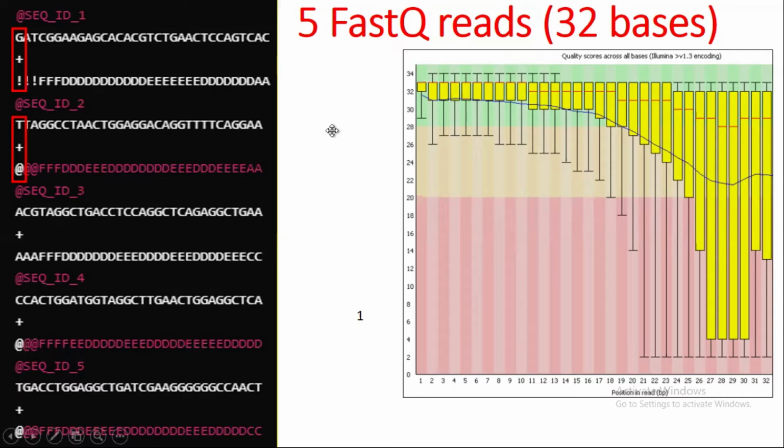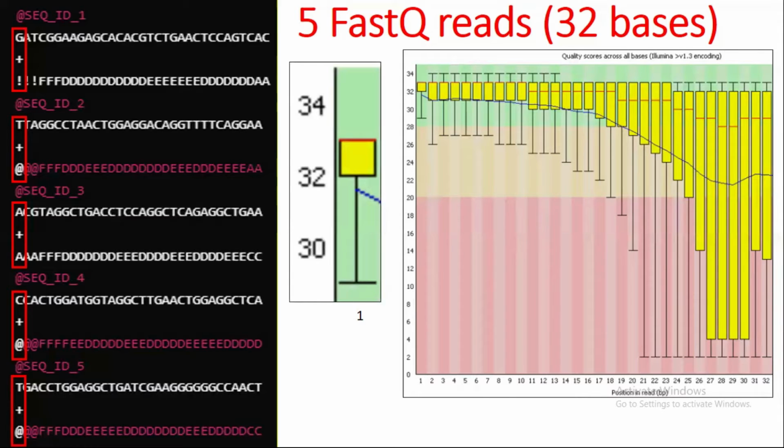These are my first base pairs, and I want to check their quality. It will be shown as a box plot, and this is the box plot for the first base pair. Collectively it represents its quality. I think you are all familiar with the box plot. It shows you a range of quality. For example, this yellow box shows a specific amount of reads that lie in this quality range, and this is the whisker.